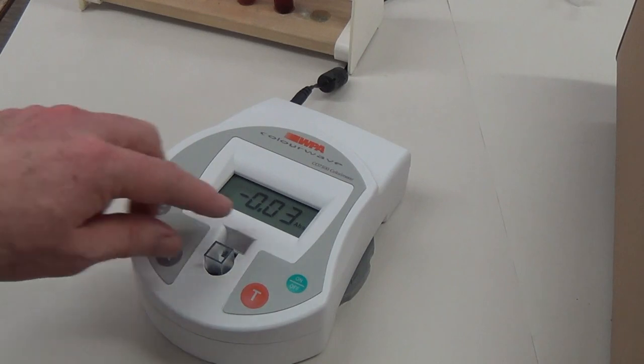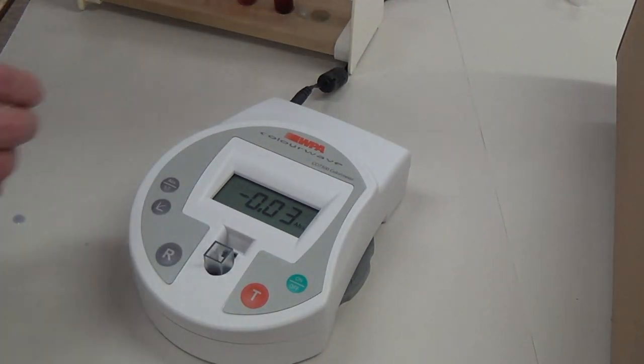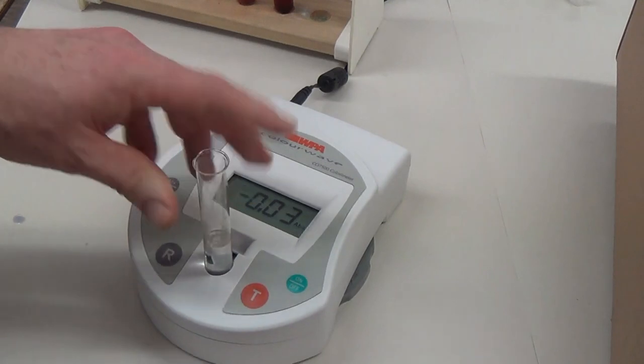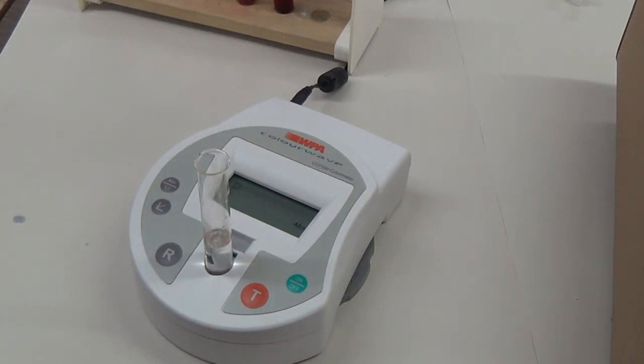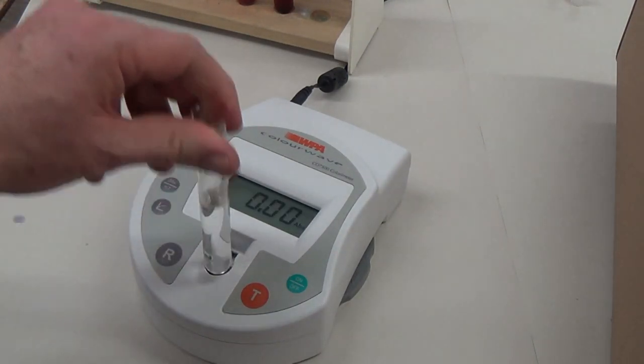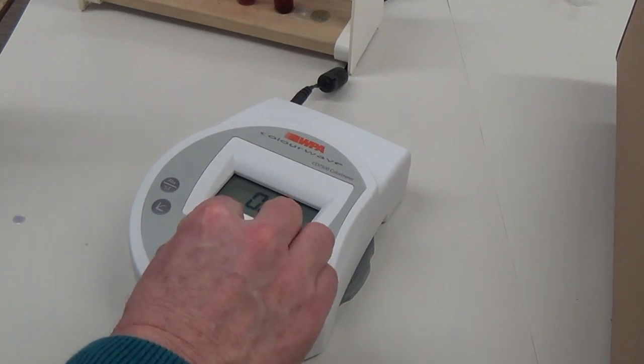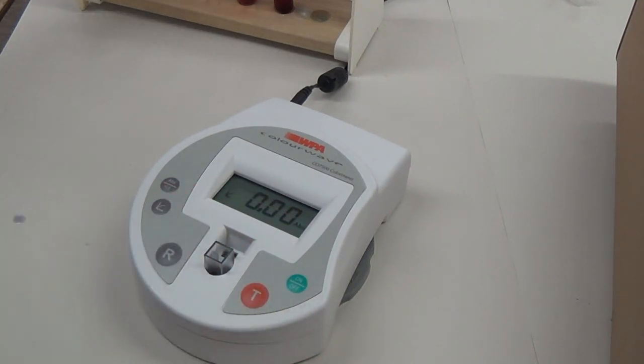I would do a reference first. Let's do the reference first. Press R, then press the cuvette in, and there we go, and start.